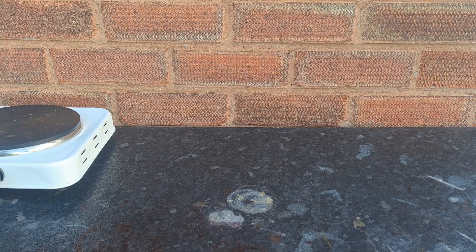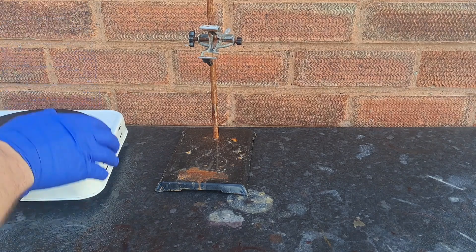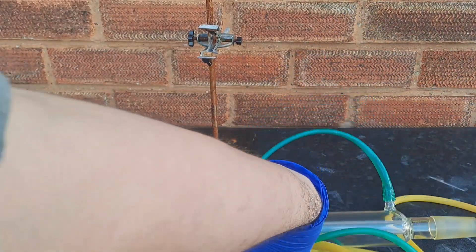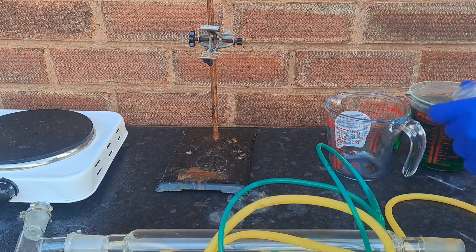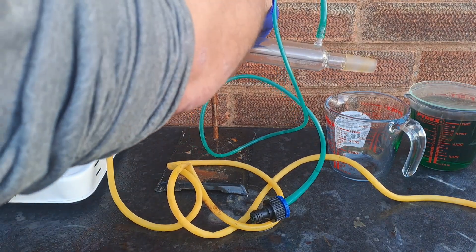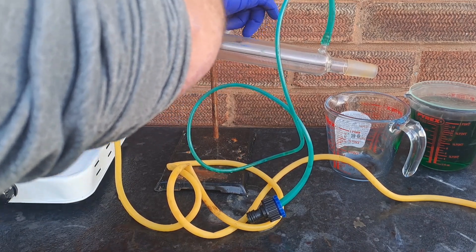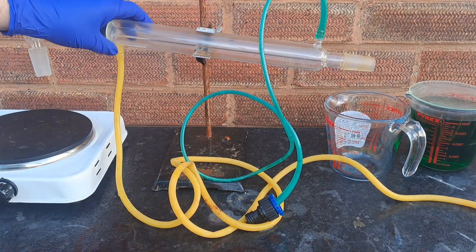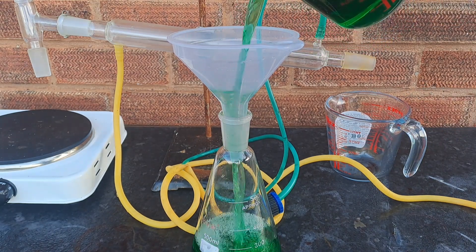So while I get set up, let's talk about some of the challenges faced when doing this experiment. Recovering hydrochloric acid directly from a copper chloride solution using distillation is generally quite tricky. In a copper chloride solution, the chloride ions are coordinated with copper ions rather than existing as free HCl. Distillation of the solution will primarily remove water and any free hydrochloric acid, leaving the bound chloride behind as part of the dissolved salt. If your copper chloride solution does not contain an excess of free HCl — for example, the solution is overly saturated with copper — then there is no significant amount of volatile HCl available to distill off. The chloride is locked in the salt.